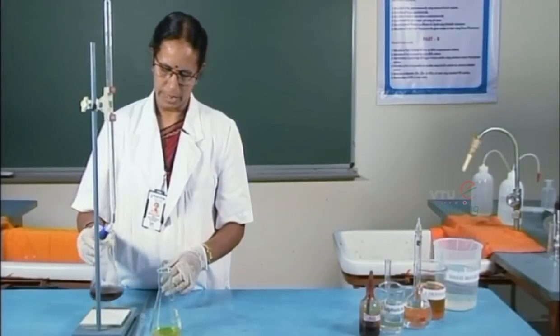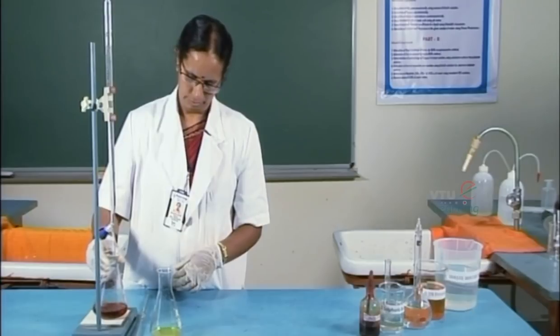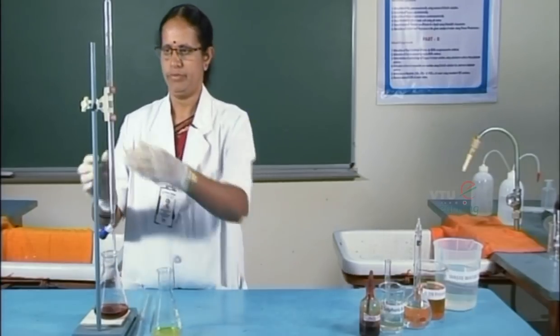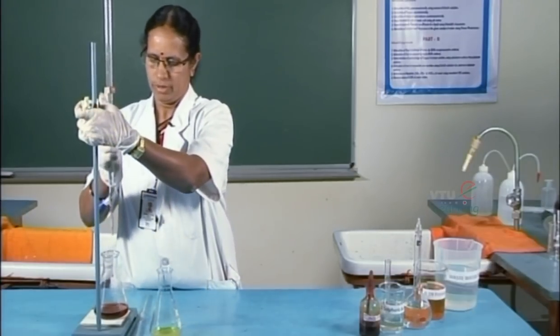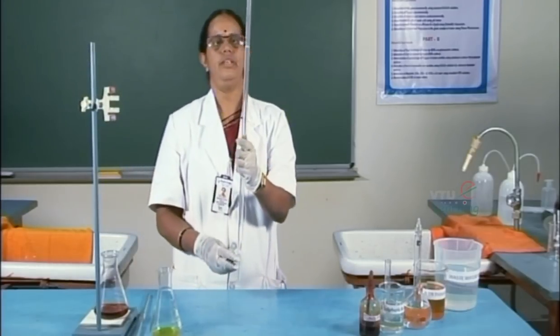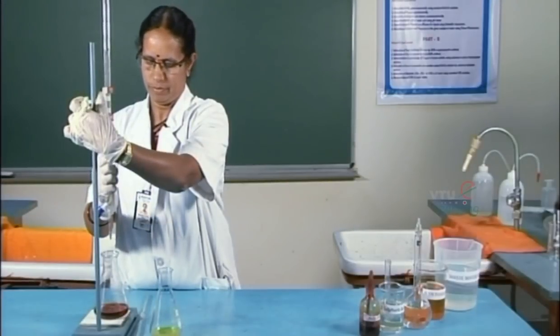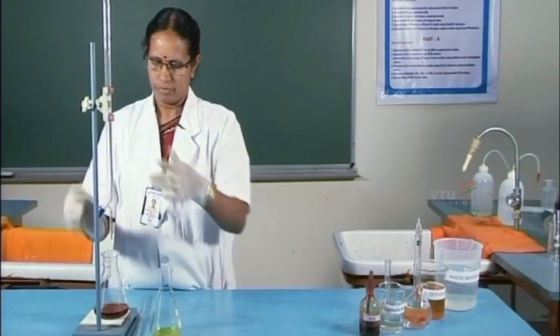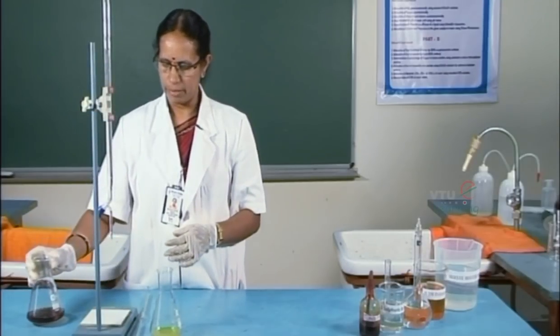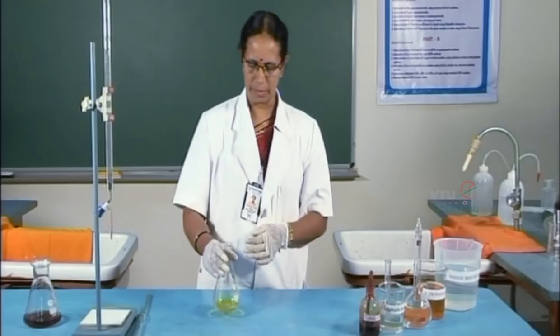So this is the back titration. The burette reading is 11.7. Now, we will conduct the blank titration, which is required for the experiment.